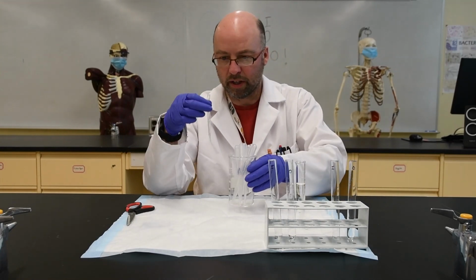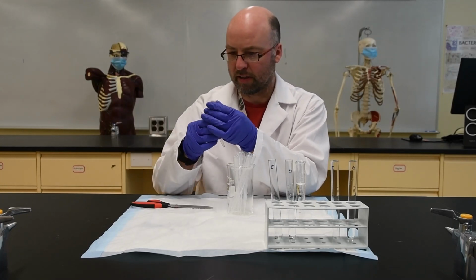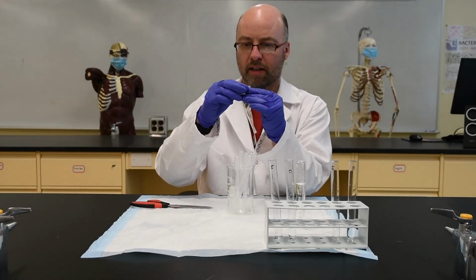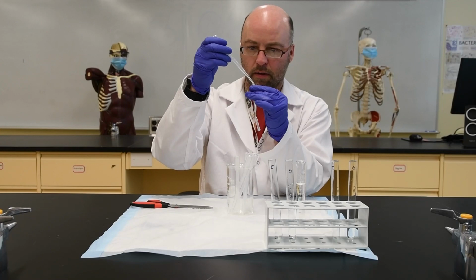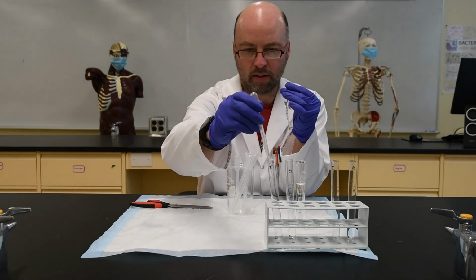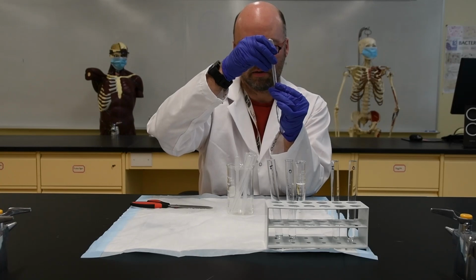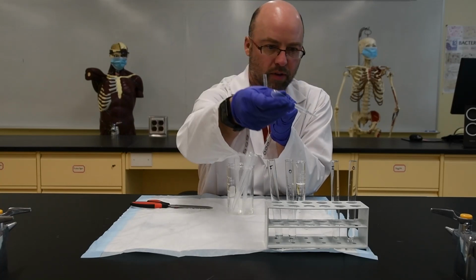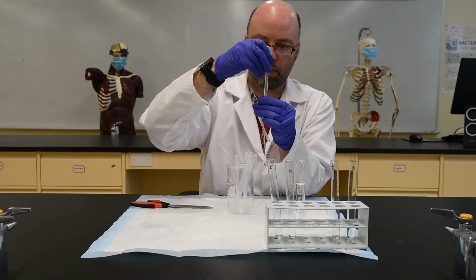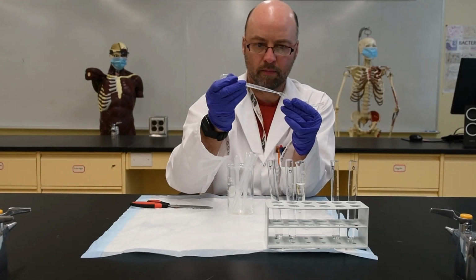And now we have to sample inside the bag. So I'm just going to cut the top off like that. If I'm careful, I should be able to get some of that out of there and put it in that one. There's some inside, and here's a bit more of that. Put that on the inside. You just have to make sure not to contaminate the other tubes. A little bit more in there. Finally.